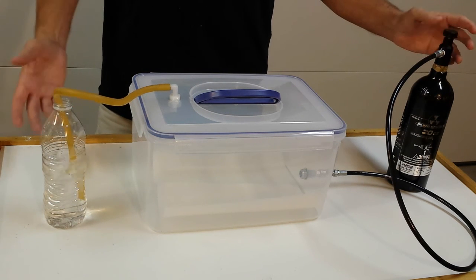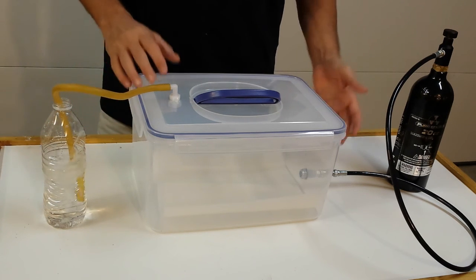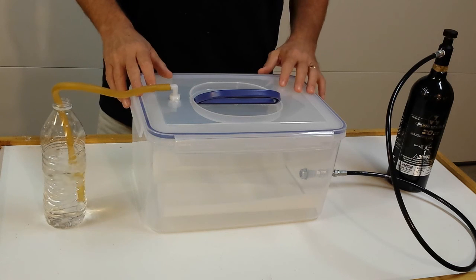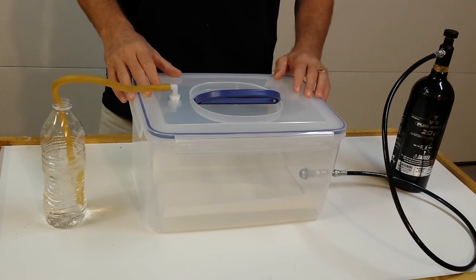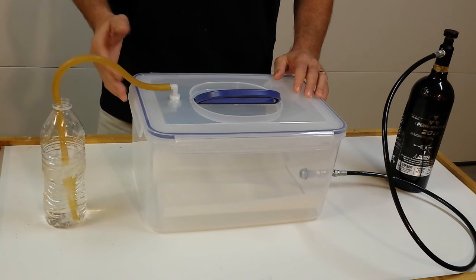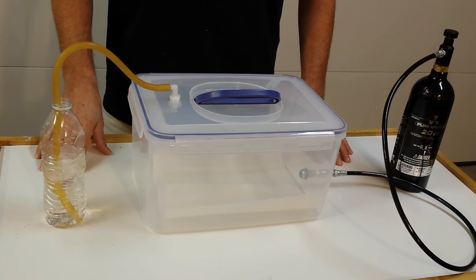You can see it's pretty strong, so I'll kind of back off a little bit. I start off slow. They say that you're supposed to let them start to fall asleep, and when you see them kind of in that sleepy mode, then you increase the gas. And it should take about three minutes for them to expire. And that should be it.